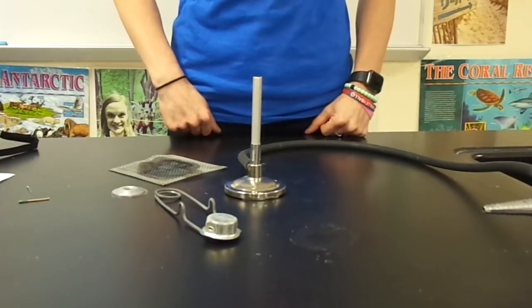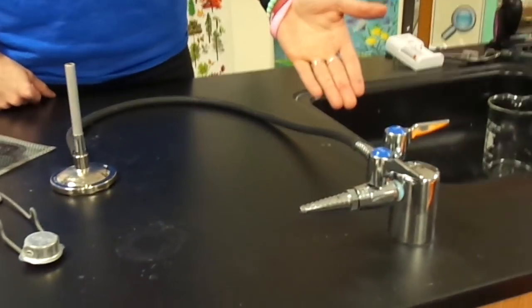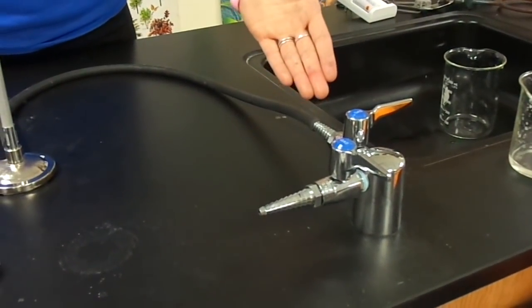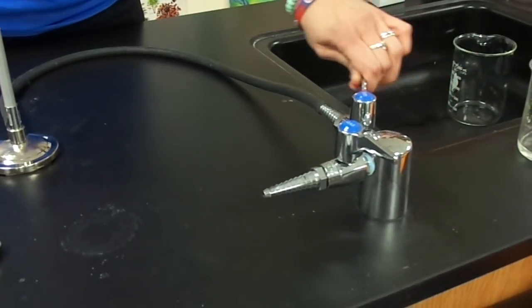Now we're going to turn the gas on at your station. To turn the gas on you'll notice that right now the handle is perpendicular to the valve. In order to get the gas flowing we need to take the handle and make it parallel. Now gas is flowing.